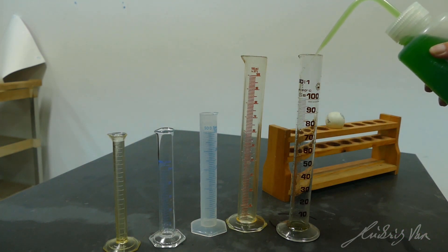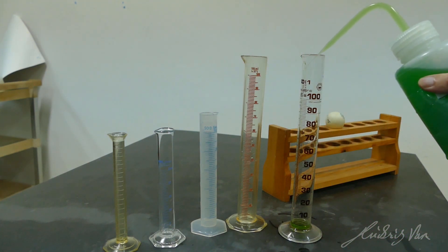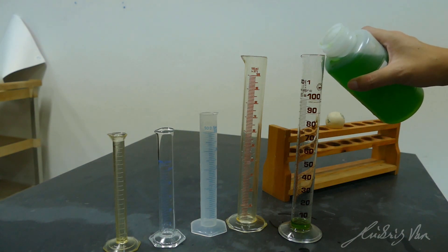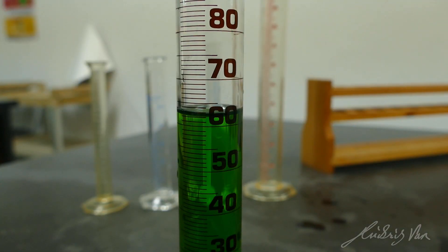So I can squirt it in, but you can see that if you are given this kind of squirty bottle, it can be very slow. So what I like to do is to open the cap and just pour it right in. So just be careful.